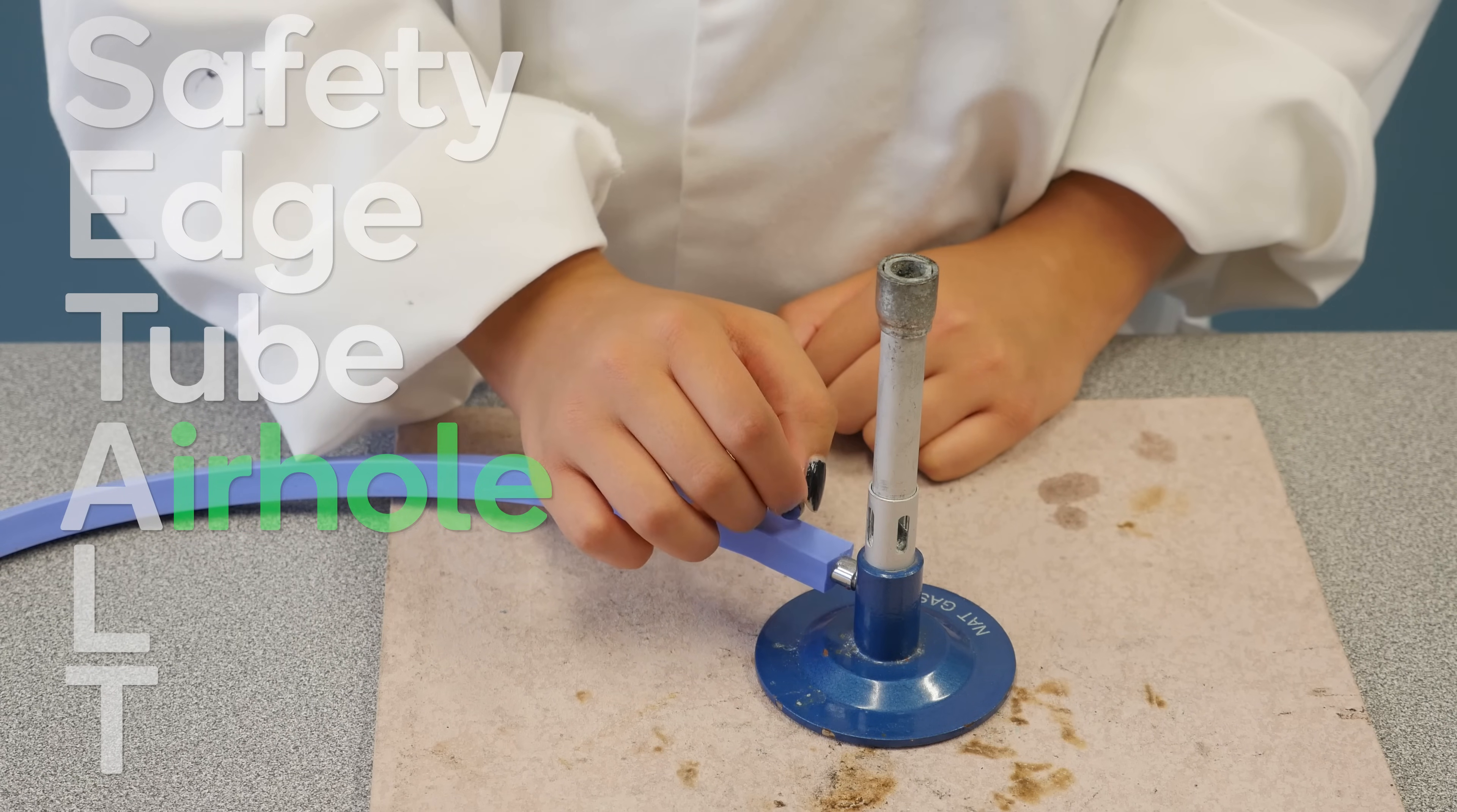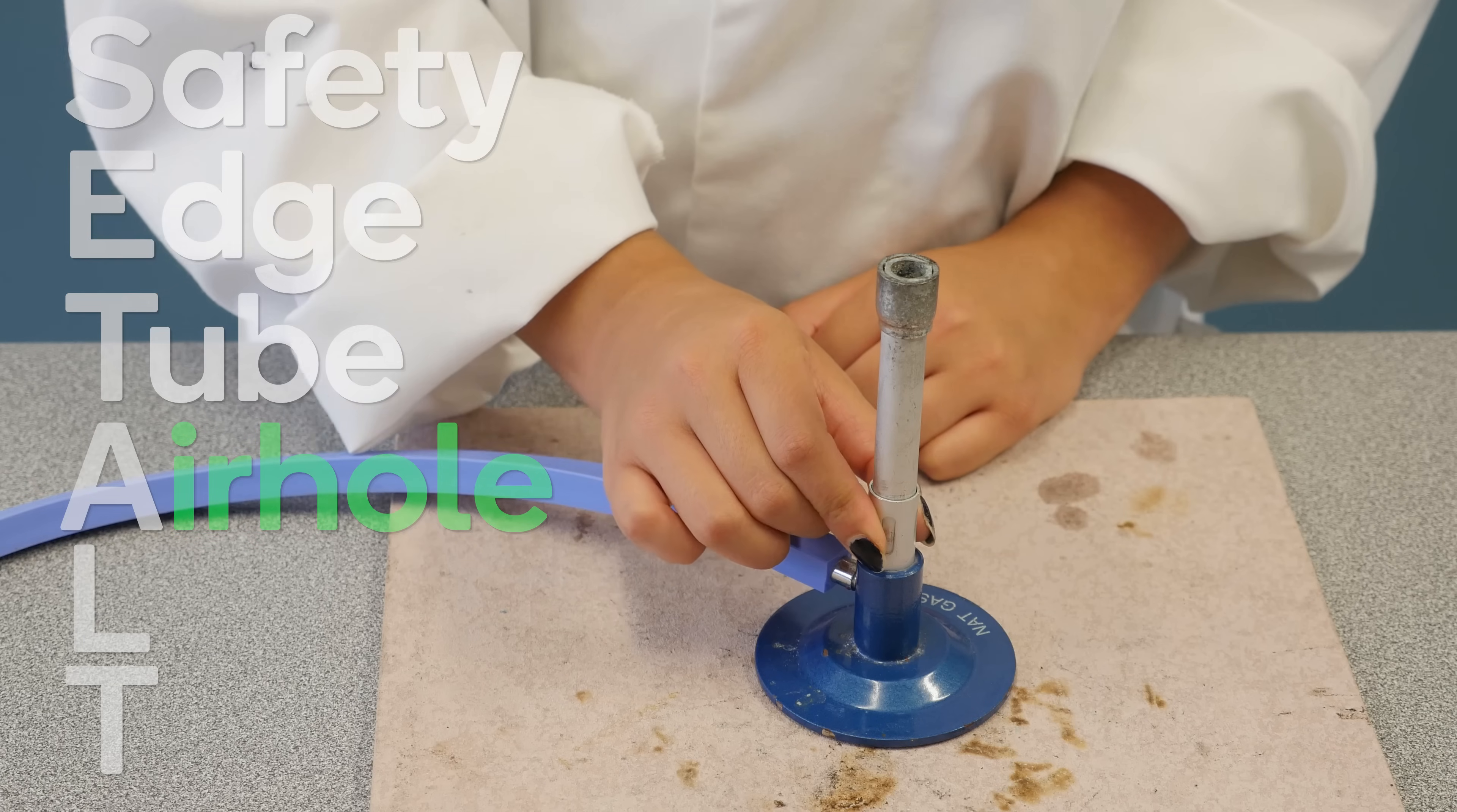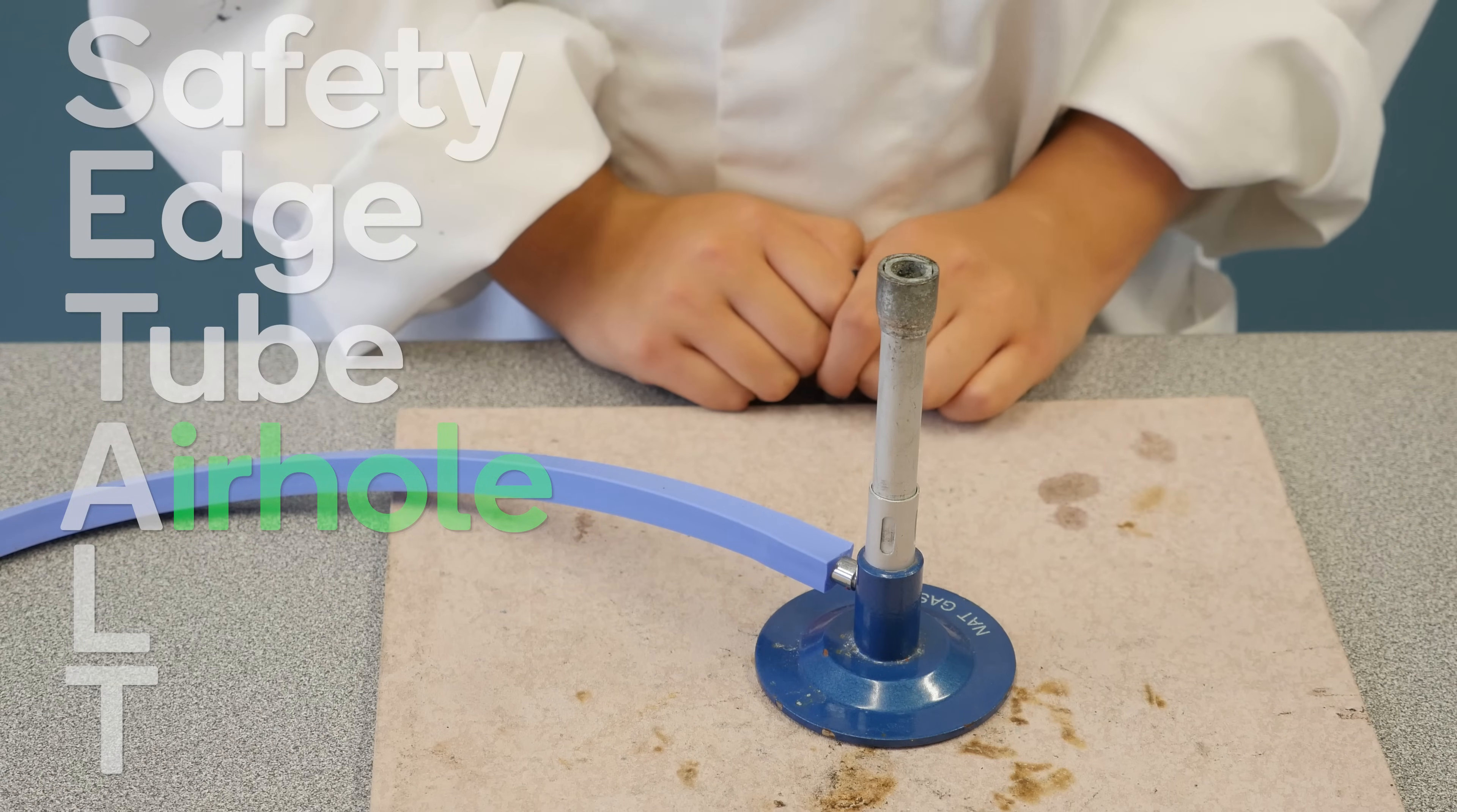The more oxygen, the hotter the flame. Always make sure that the air hole is closed before lighting the burner.